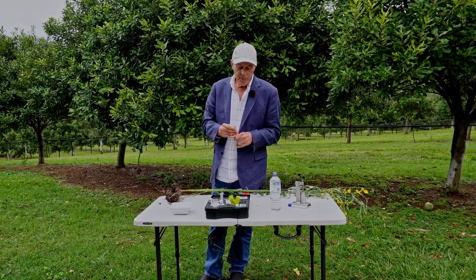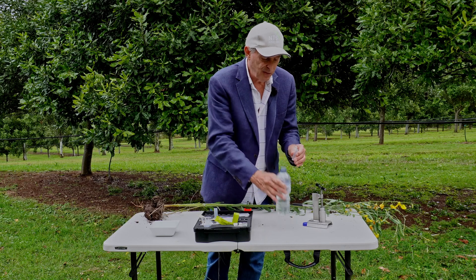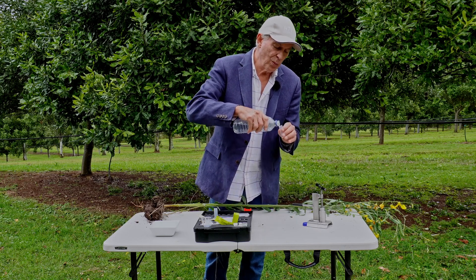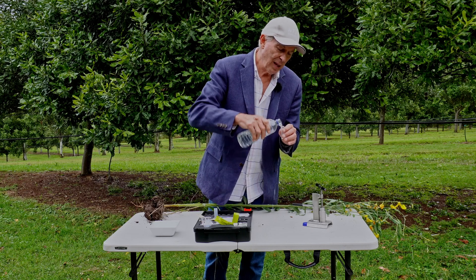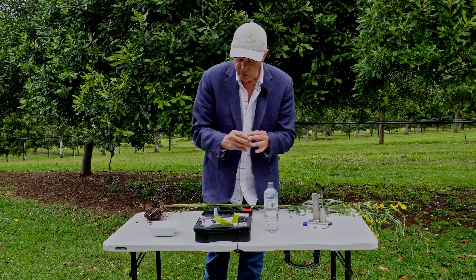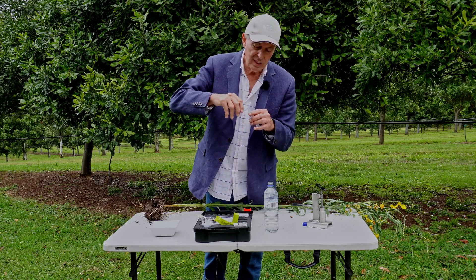He planted this particular soil with three cover crops between each ginger crop, which is really unusual because ginger usually has a five-year spell — but he does three cover crops and then puts ginger back year after year, growing beautiful ginger. The soil is like a sponge when you walk on it. We're going to start by taking a sample. First, you get a little container and fill it with water — the amount is very precise, fully filled, and that's important for accuracy.